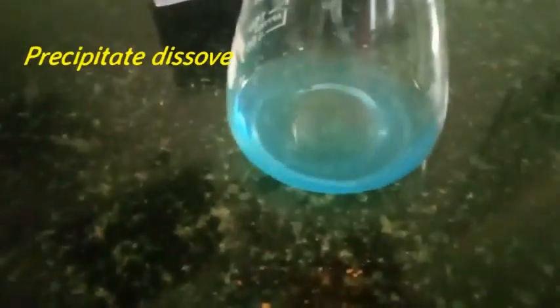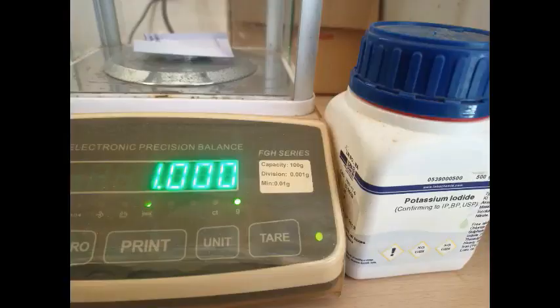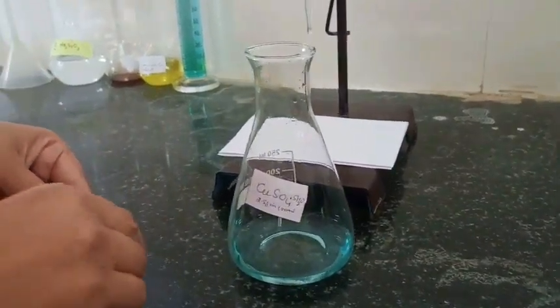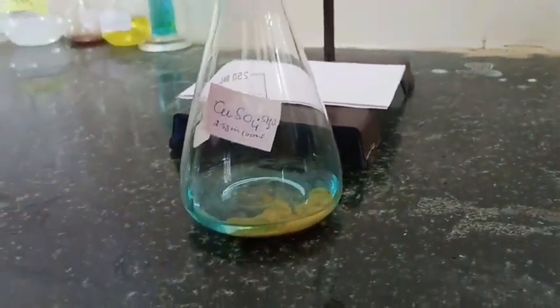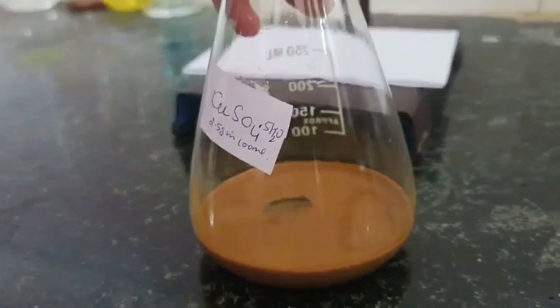We are then going to add acetic acid to dissolve these precipitates. Once dissolved, we add potassium iodide to this solution — about 1 gram of potassium iodide. This is also a confirmatory test for copper, as it gives a brown precipitate.